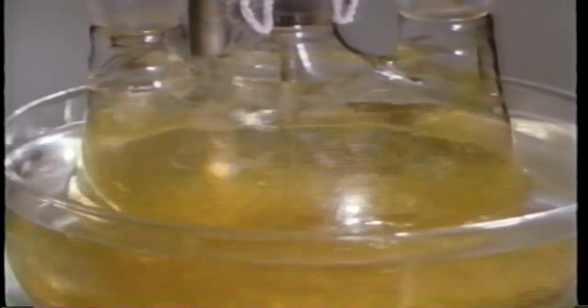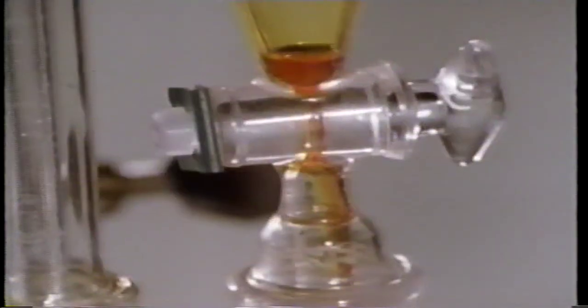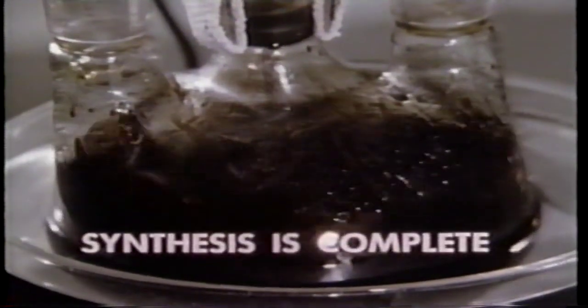The oxidation begins, releasing heat. The heat is absorbed by the water bath around the reaction flask. As the reaction proceeds, the color changes from the orange dichromate ion to the green chromic ion. The flask now contains the ketone product, plus some inorganic materials and the solvents. The actual synthesis is now complete.